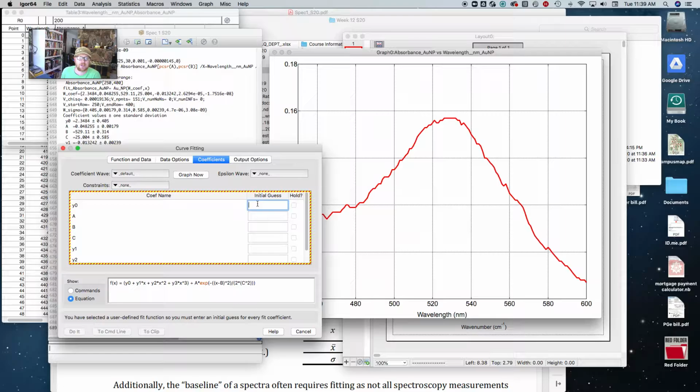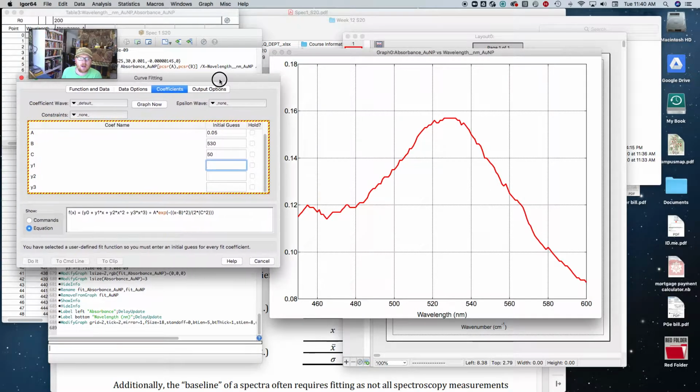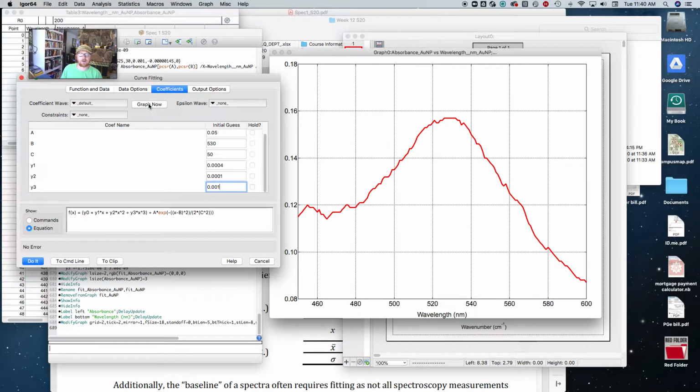So I have to enter guesses of coefficients. So A, I think about 0.05 works. B, you can see it's right around 530 nanometers. Maybe the width of this thing is 50 nanometers or so. And for my y0, I'm going to say 0.12 right there. Okay, and then here's all these other polynomial terms. I'm just going to put in really small values for now. I'm just guessing, and I'm going to do this graph.